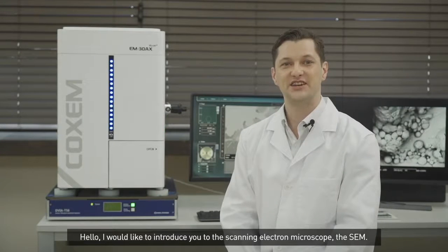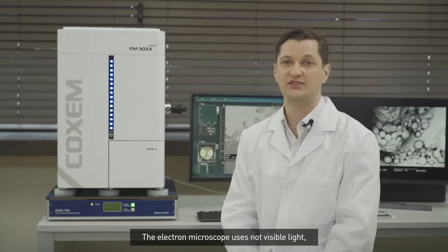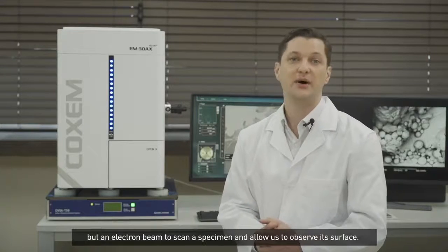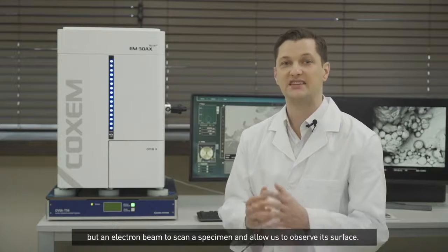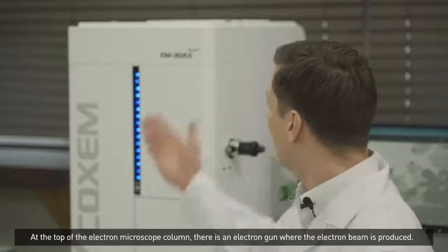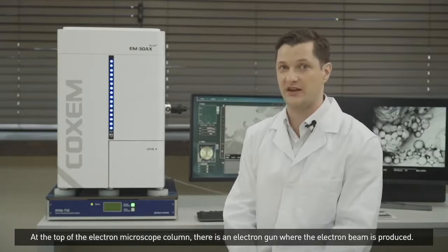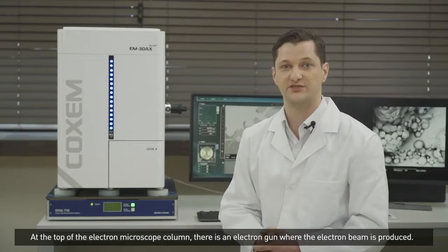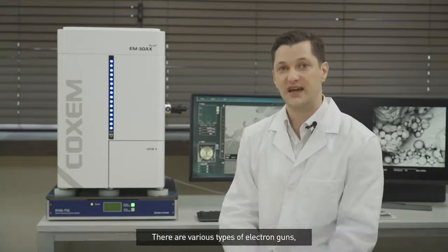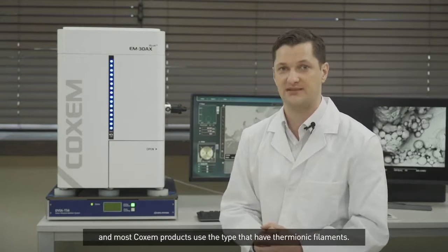Hello, I'd like to introduce you to the Scanning Electron Microscope, the SEM. The electron microscope uses not visible light, but an electron beam to scan a specimen and allow us to observe its surface. At the top of the electron microscope column, there is an electron gun where the electron beam is produced. There are various types of electron guns, and most COXEM products use the type that have thermionic filaments.